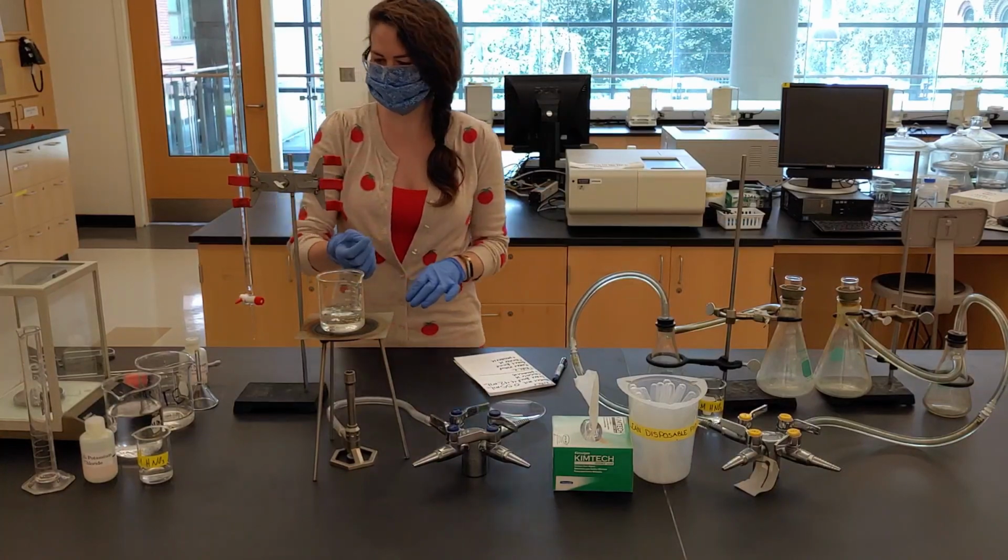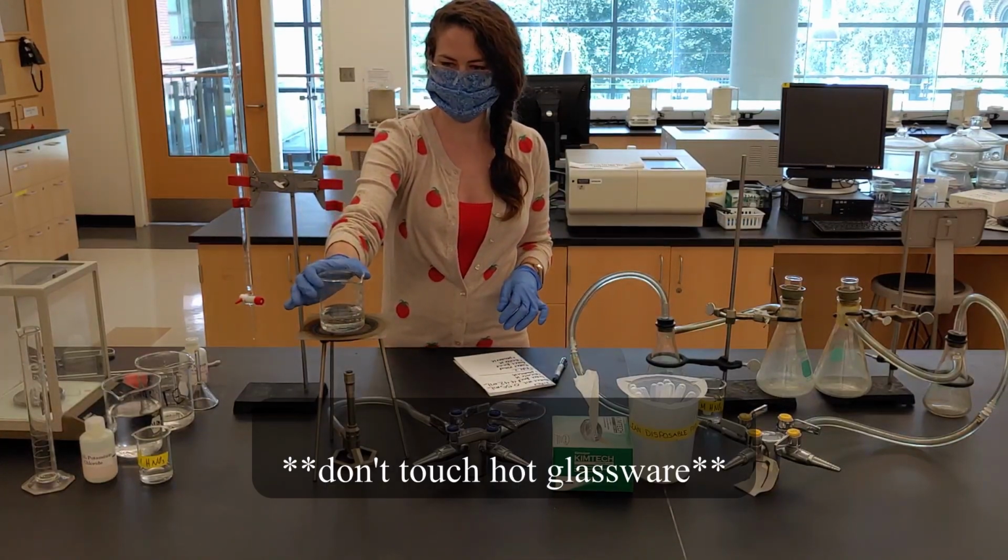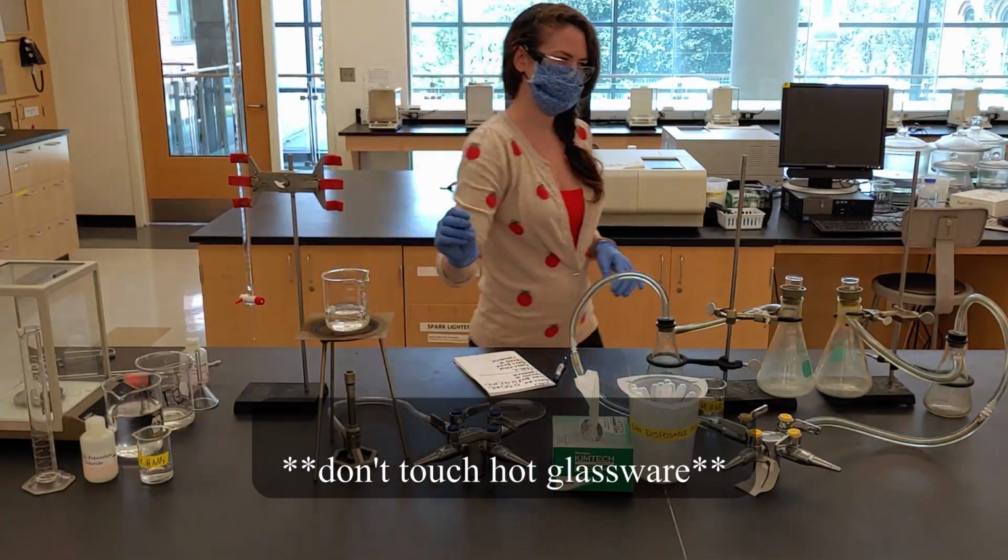Once the second trial is boiling, turn the gas off and remove the beaker from the tripod.